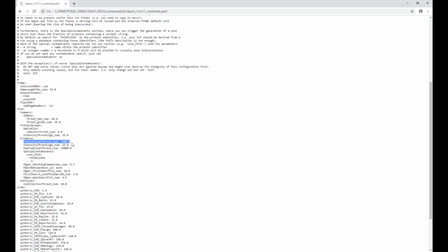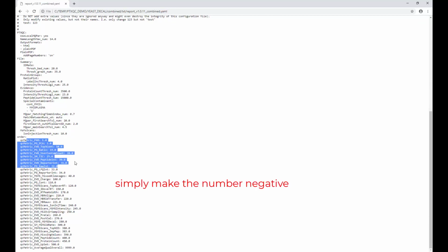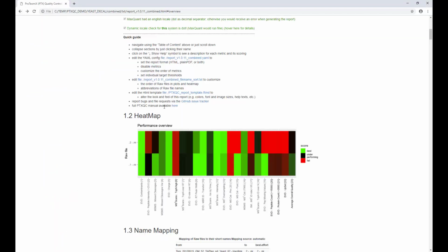Most metrics have a scoring scheme which is independent of magical thresholds, but there are some, right, which you can set here. You can also enable or disable certain metrics if you find them not useful for your scenario. All of this, given that once you change the file using any text editor of your choice, you need to rerun the report generation, and then this config file will basically kick in. All right, let's go back to the report. What else do we have?